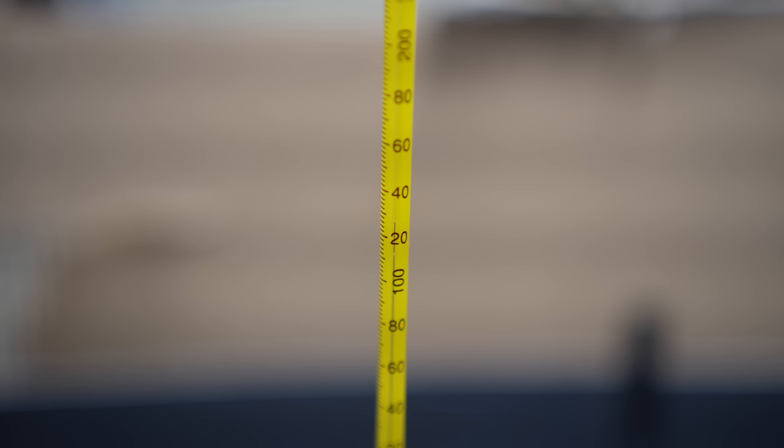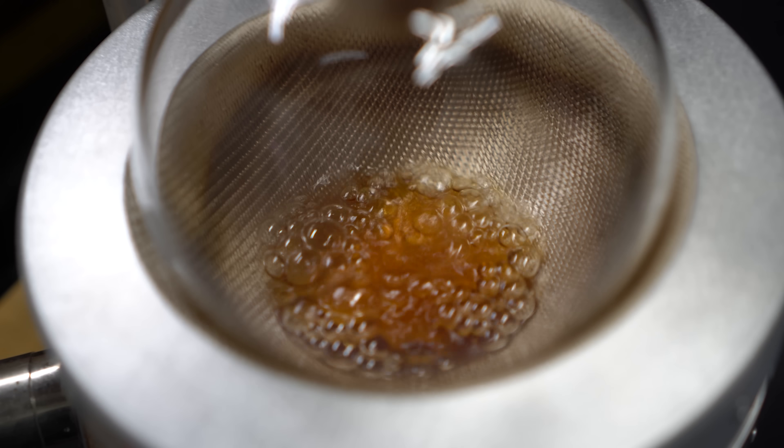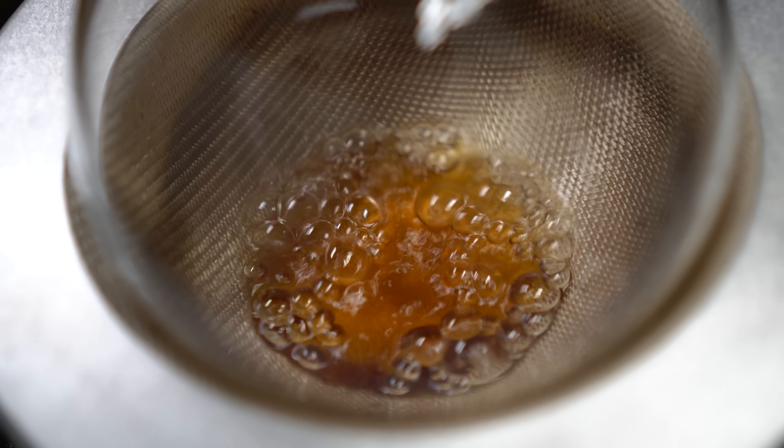As more of it boiled over, you can see that it took on more of a slightly orangish, yellowish color, but it eventually turned fairly orange as time went on. Here, you can see it's just about 124 degrees Celsius. Yes, there is a small air bubble in there. Yes, it is annoying. Here is where I stopped the distillation. Now, I could have kept going, but I just wanted to be safe and really not have to deal with any of those bromine vapors.